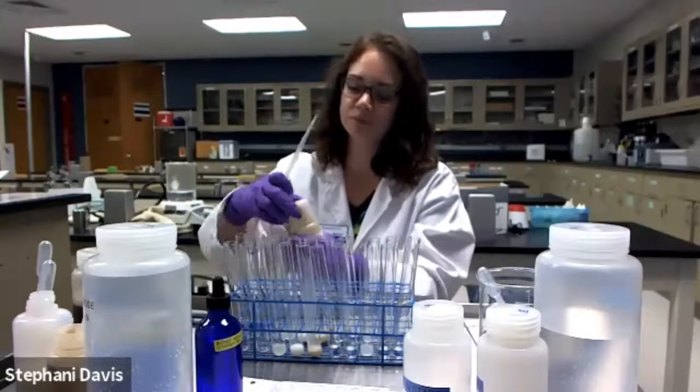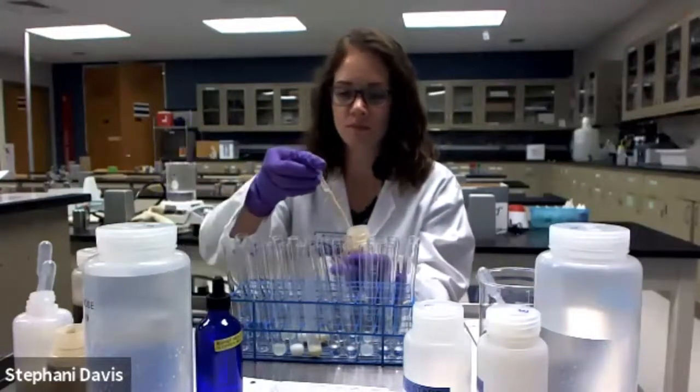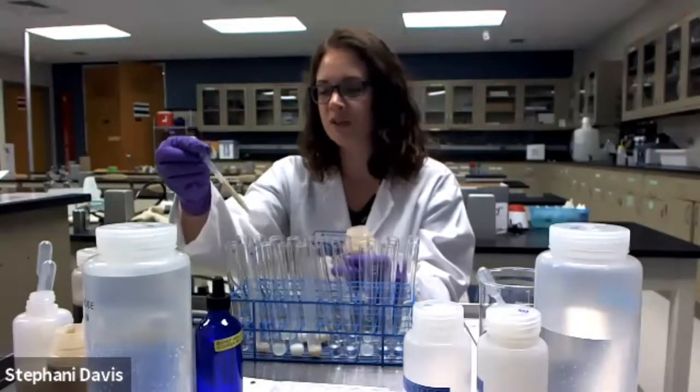Next, we have banana. It's a little bit viscous. All right, and in my last tube, I'm going to add potato homogenate.